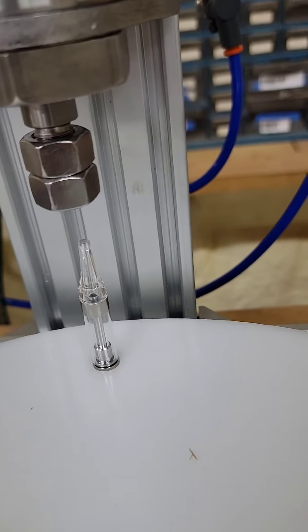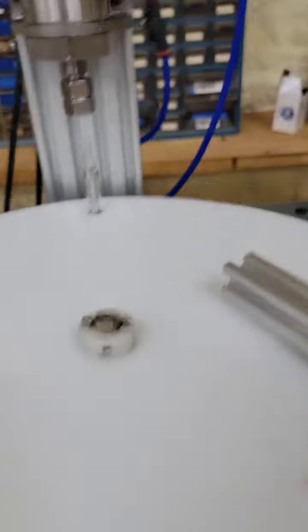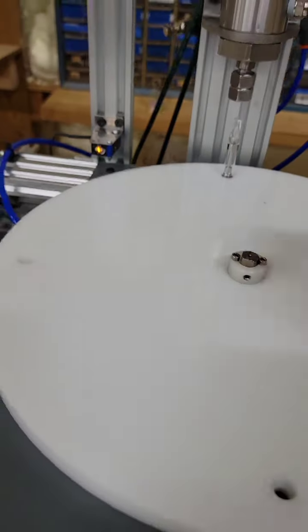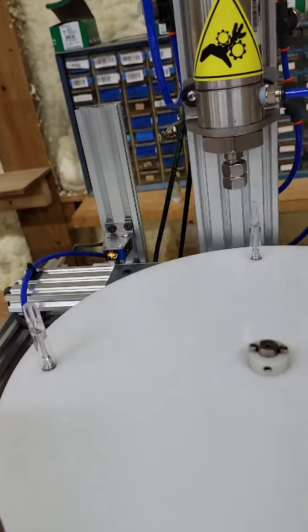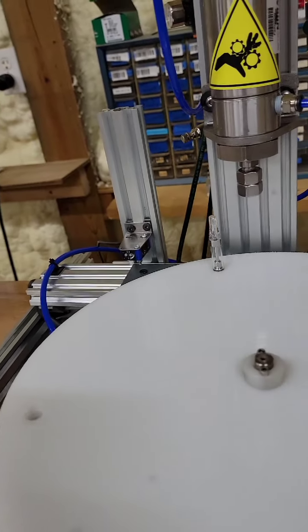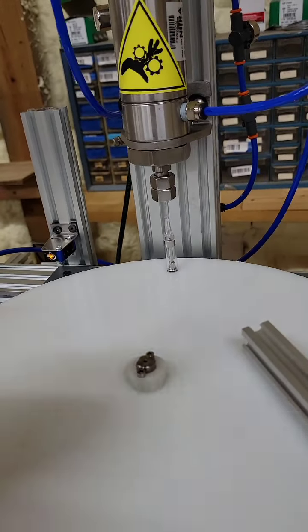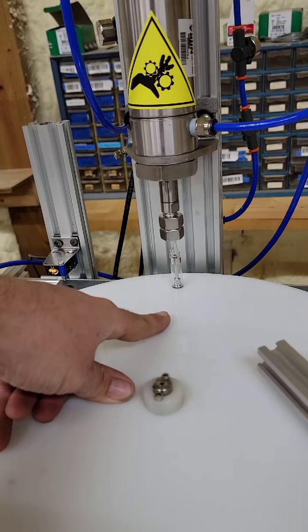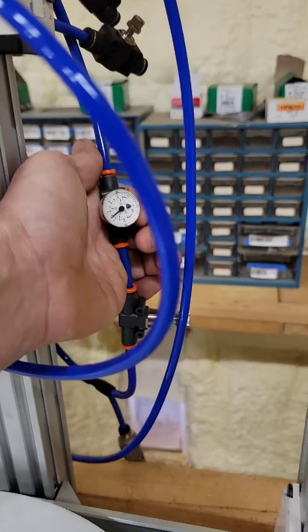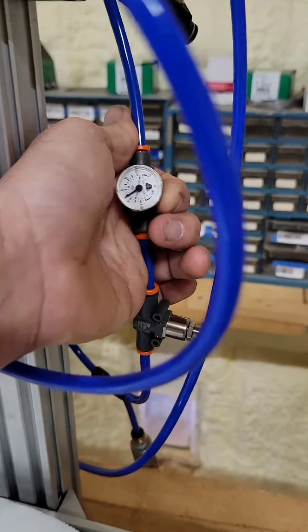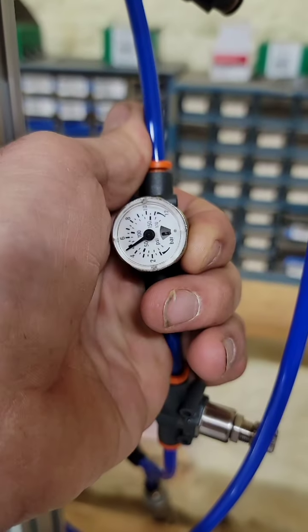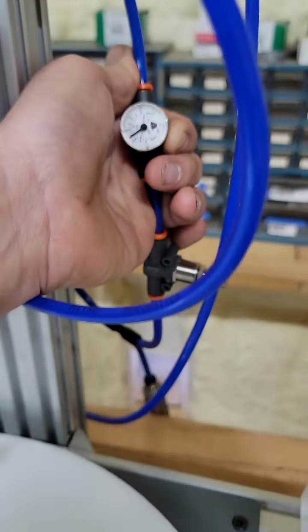Let's see. So, yeah, I don't think you really need an HMI or anything like that to run this thing. Basically, you just put it in and go. So, as far as if it's not tapping hard enough, you would adjust this guy here. You can bring it up and down. Basically, I have it right about five bar, which kicks butt.